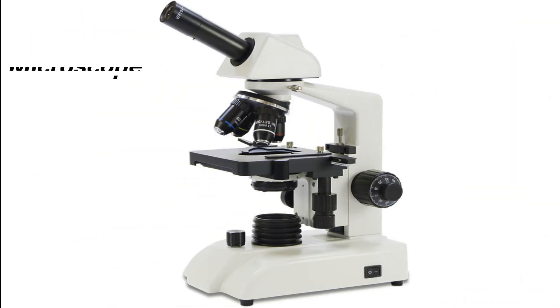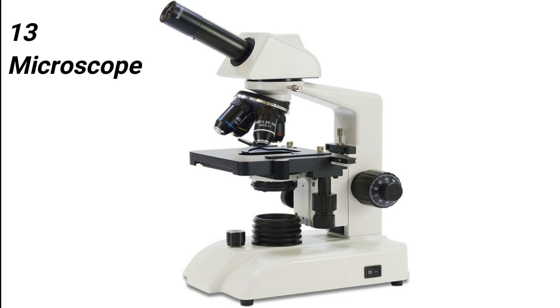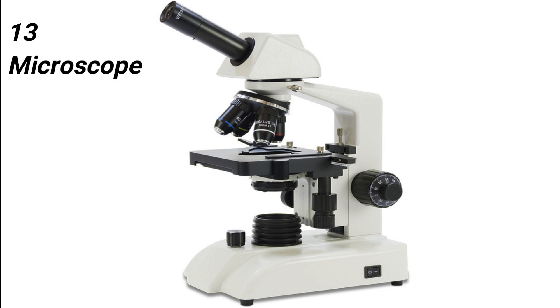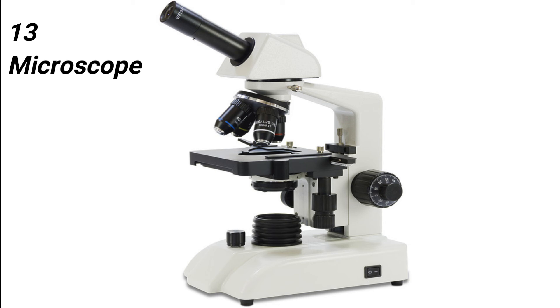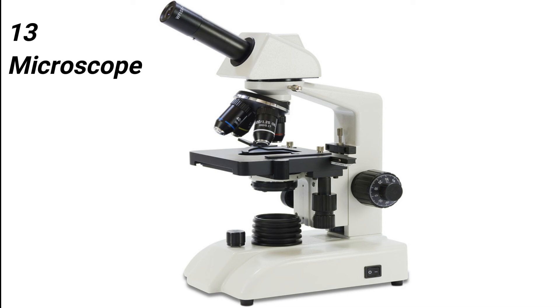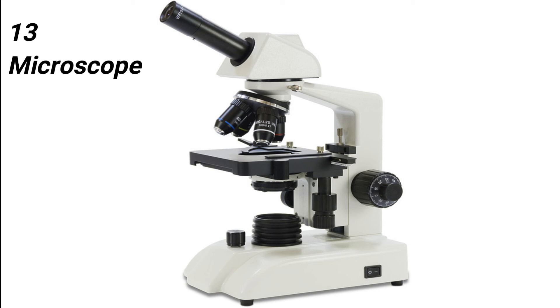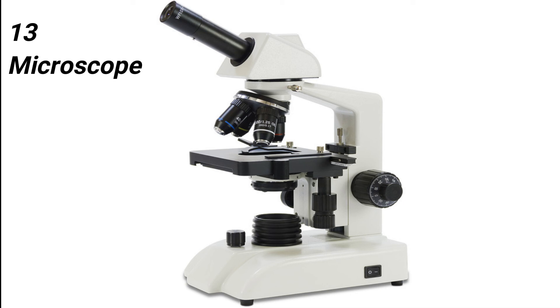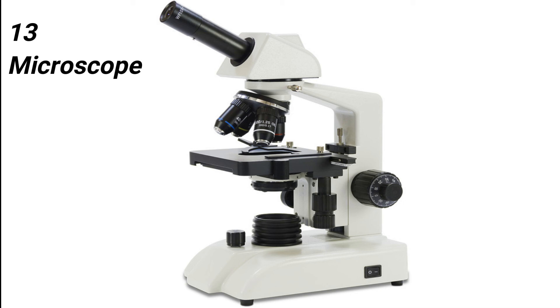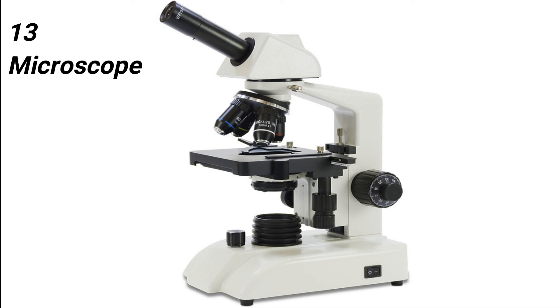On number 13, I would like to tell you about microscope. Microscopes are devices that allow the observer an exceedingly close view of minute particles. There are many types of microscopes used by microbiologists to see microorganisms. Based on the type of microscope, different microscopes are used for different purposes, and they are primarily used for the observation of minute particles which cannot be observed with the naked eye.